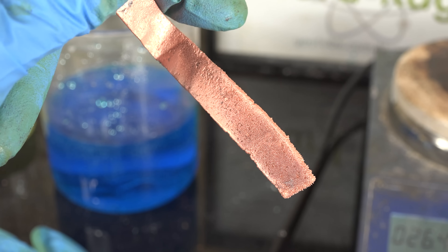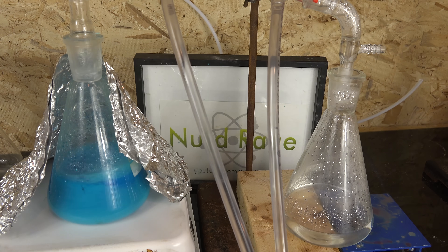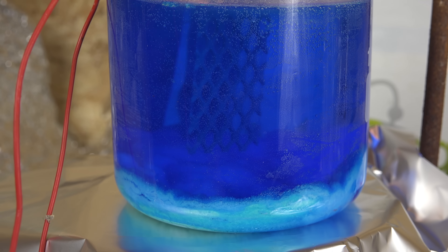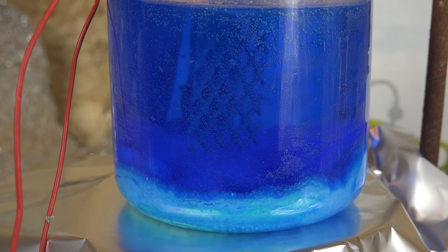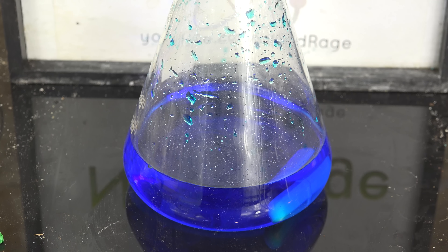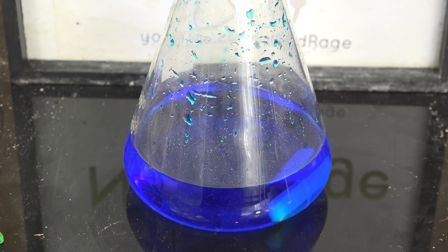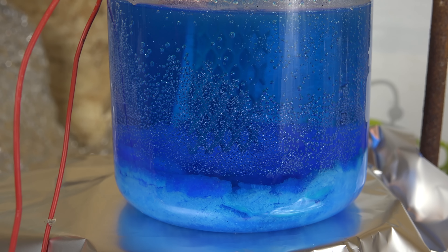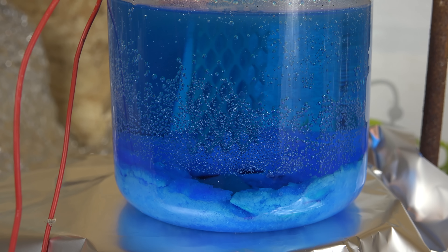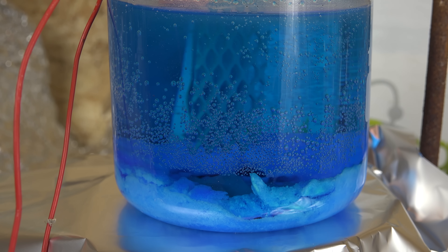So that's how we can recover nitric acid and copper metal from copper nitrate wastes with very high efficiency using some sulfuric acid, a platinum electrode, and electricity. The platinum electrode and sulfuric acid are both reusable for numerous cycles. You might be asking: can you electrolyze the copper nitrate directly and produce copper and nitric acid that way? Unfortunately no, as electrolysis of nitric acid tends to destroy the nitric acid. And any amount that is produced will immediately begin dissolving the copper again that was just deposited. This is why we have to use sulfuric acid as our intermediate, as it does not itself dissolve copper nor does it decompose when electrolyzed.